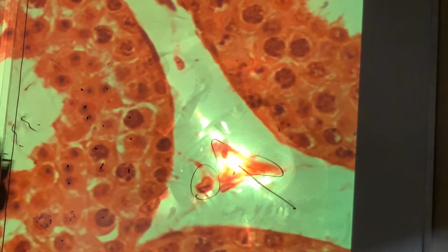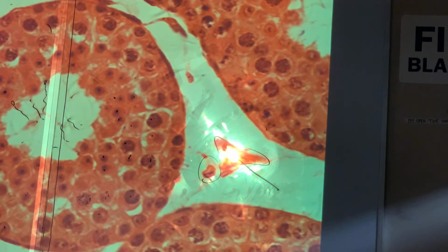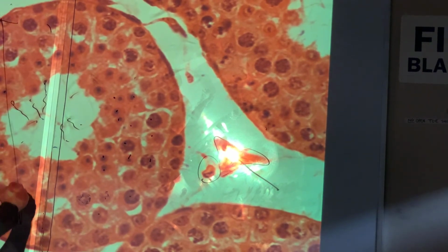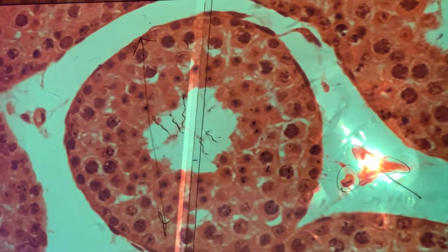If I point there, you're going to tell me interstitial cells or cells of Leydig. Again, it'll be multiple choice. Those make testosterone. This right here is a seminiferous tubule. In the wall here, you make sperm cells. This is a slide of the testes. That's what you should know. Take it away. Okay, then we're going to put up the epididymis.